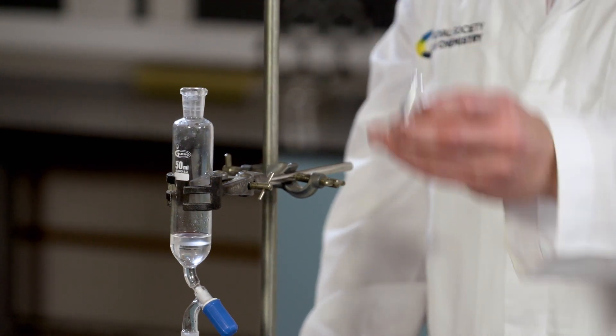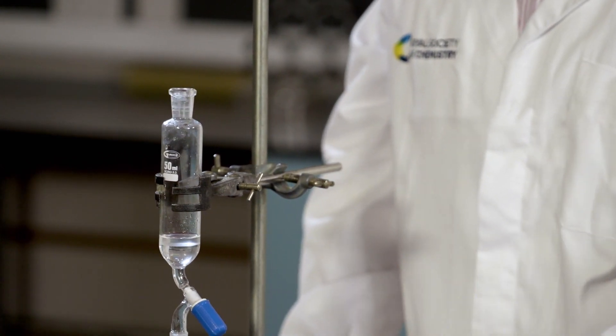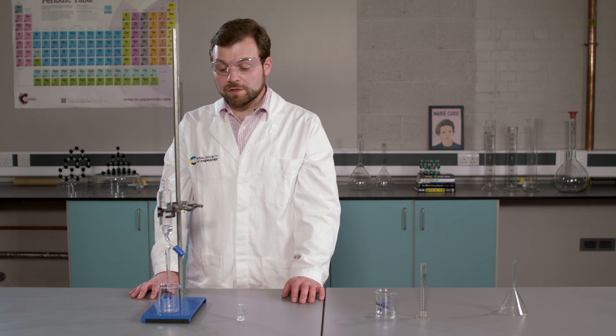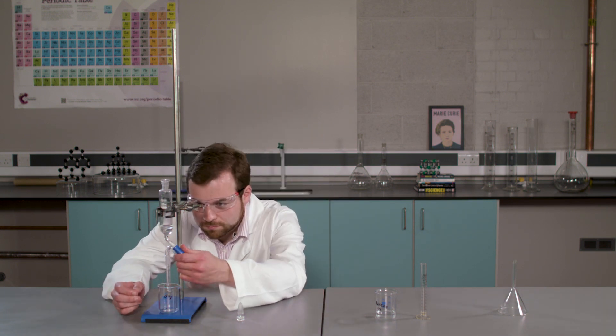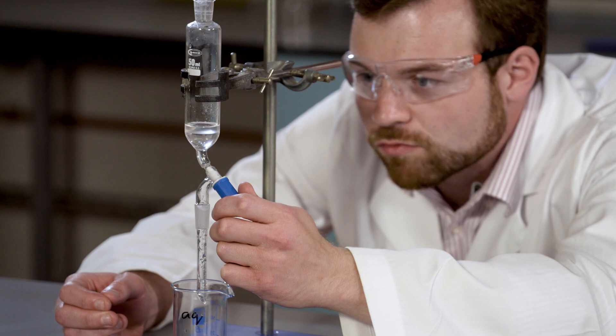Again, this is the bottom layer in our separating funnel. Before we open the tap, I need to remove the stopper from the separating funnel. I'm now ready to open the tap. Again, I'm going to stop it when all the aqueous layer is removed.